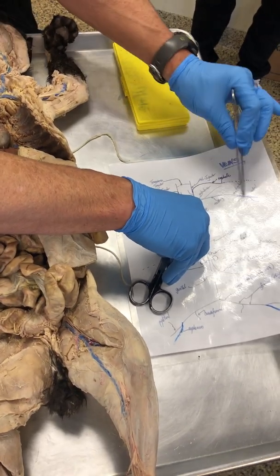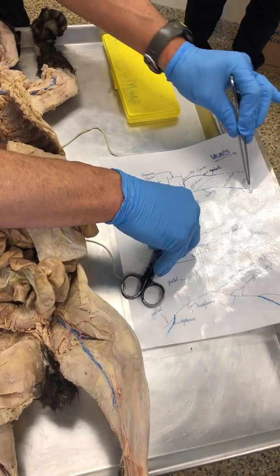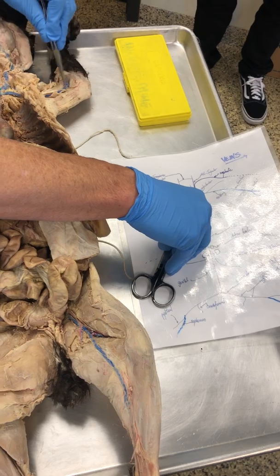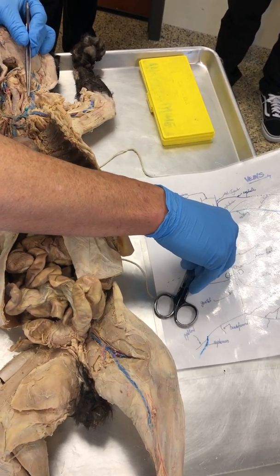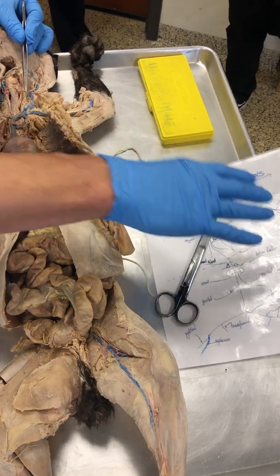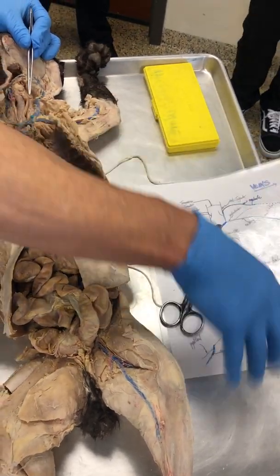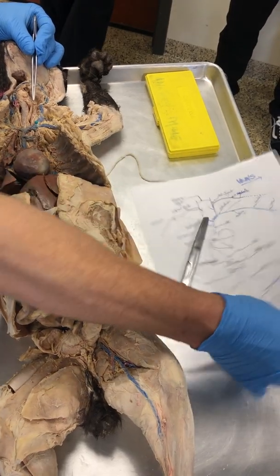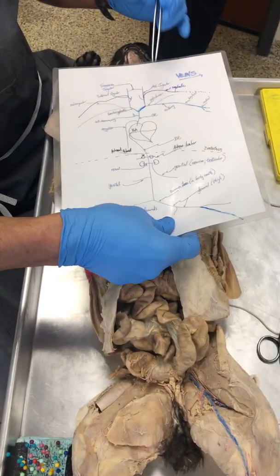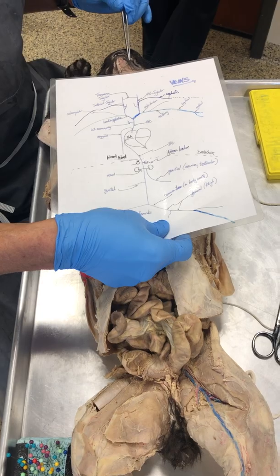A Y. What degree of branching? And the branch comes out of the upper limb right there, and it comes out of the neck right there. Okay? So head and neck. So if you want to draw the cat right there, you can. That'll be the cat's arm, and that'll be the head, right, like that. So there, arm and neck.